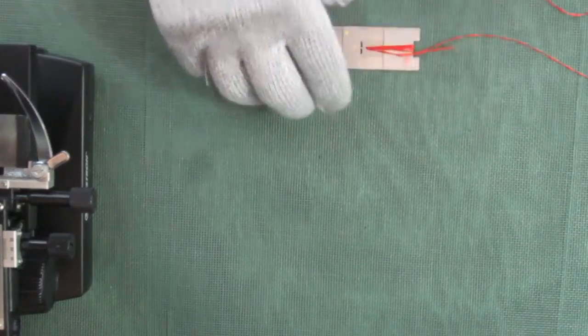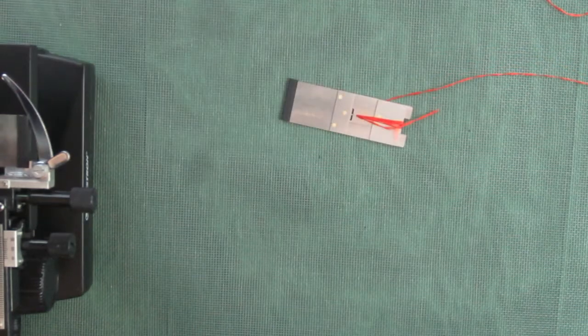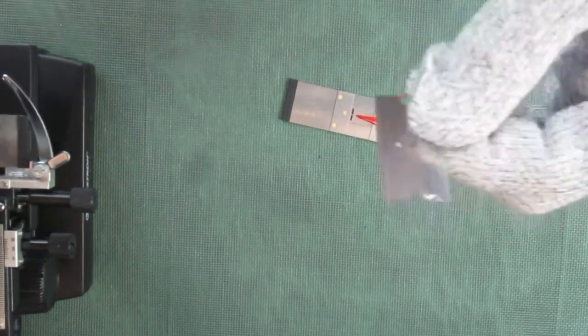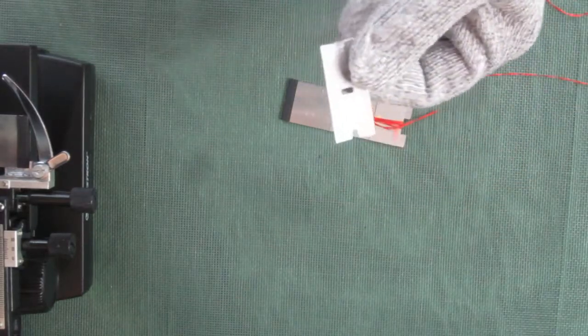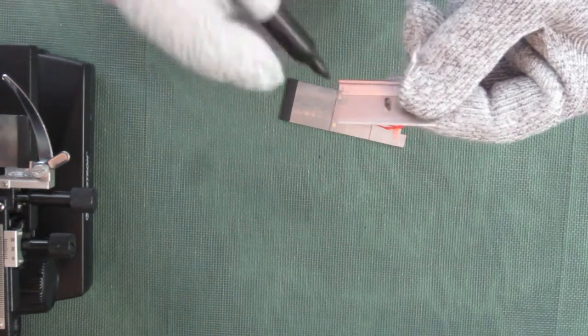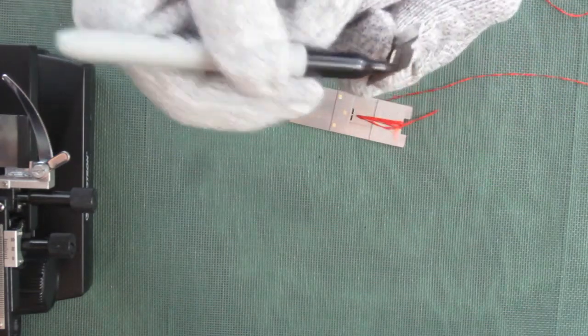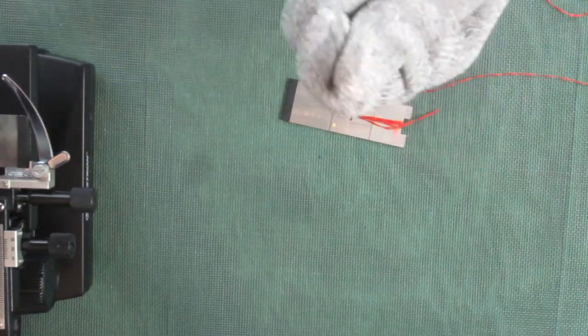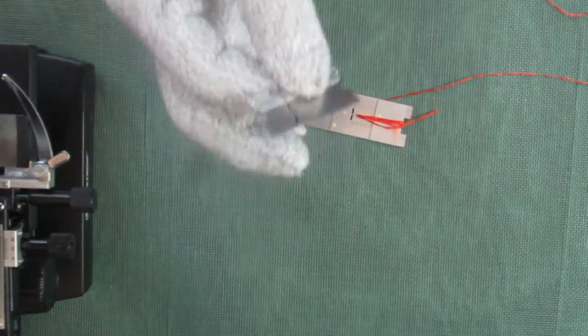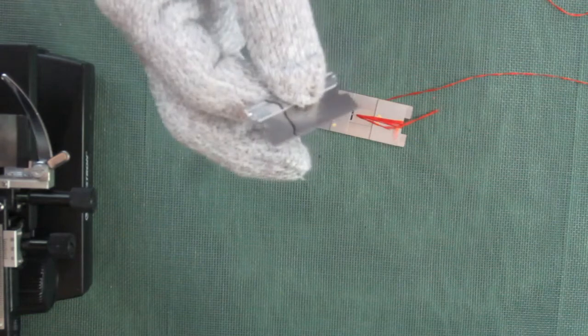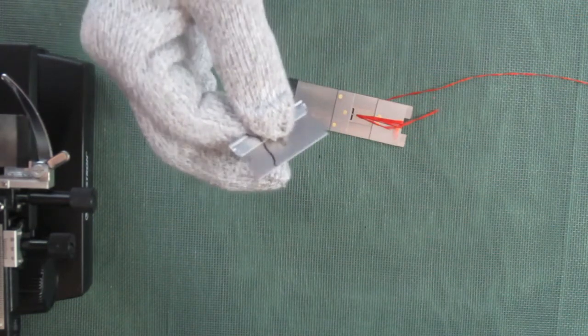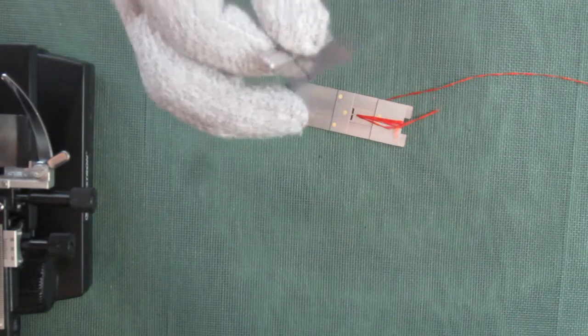Put that together and put a fair amount of pressure on it. Now for demonstration purposes, when I use this razor blade, I'm going to mark one half of it on both sides just to get a point across that you can only use a razor blade for one sample. You get two cuts with one razor blade - one half of the razor blade will take one cut, the other half will take the other cut, and then discard it or put it back in the disposable box.